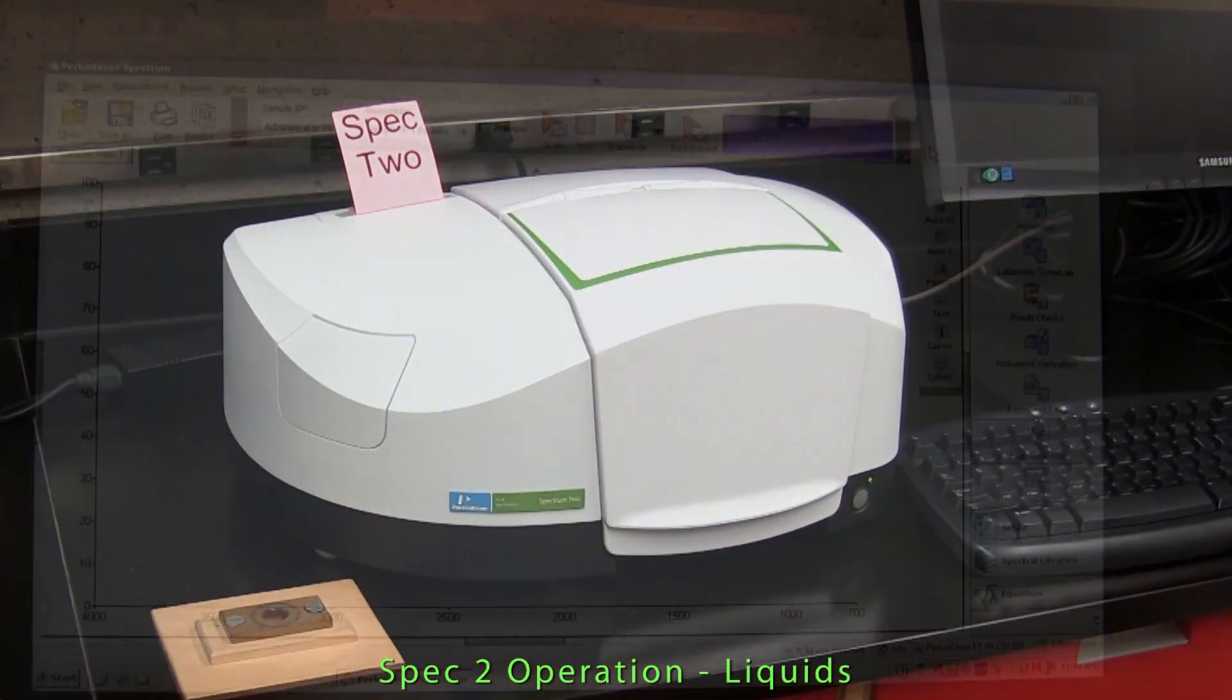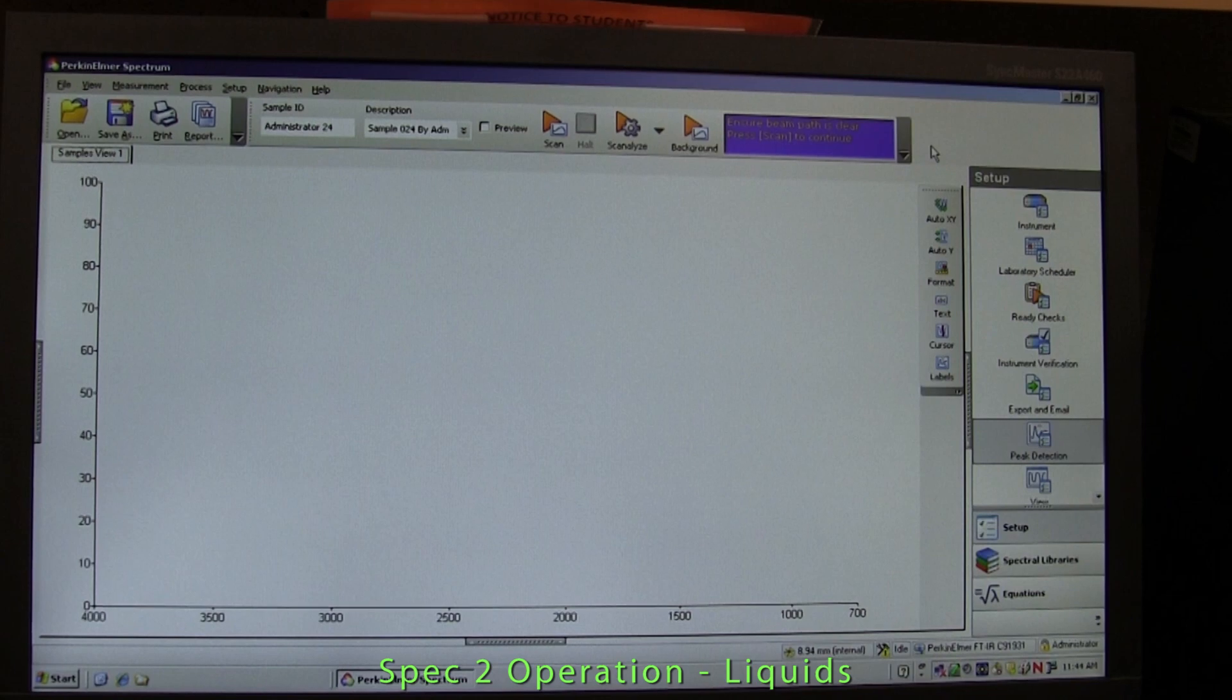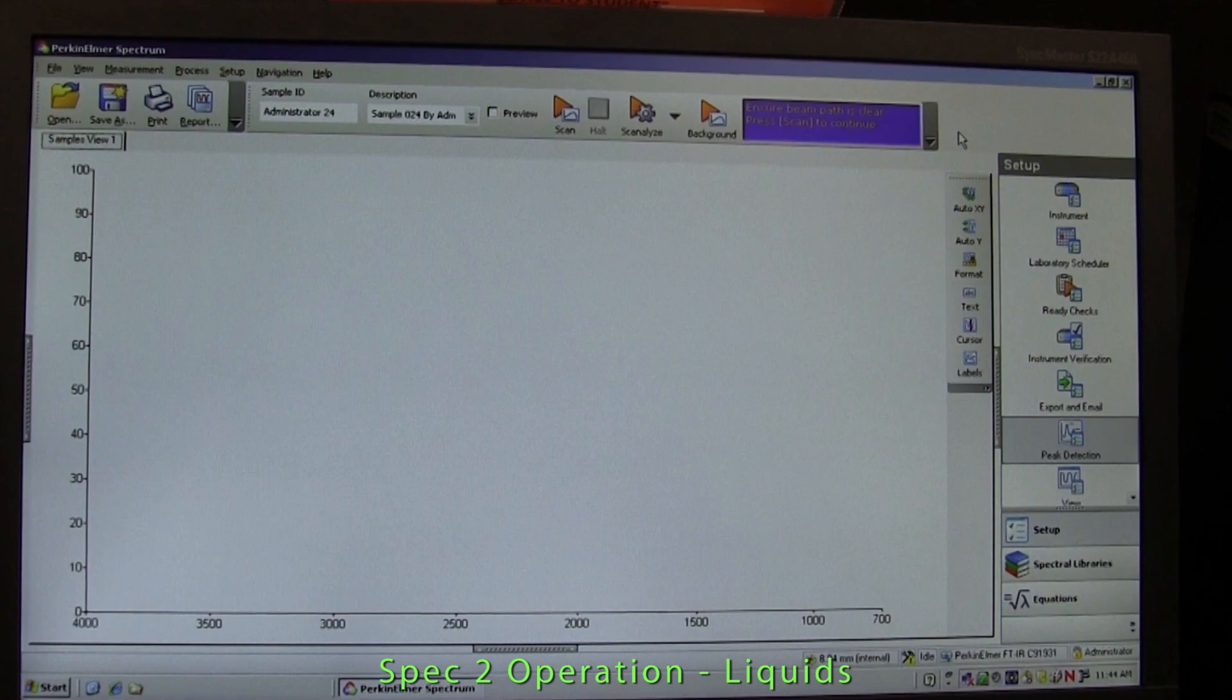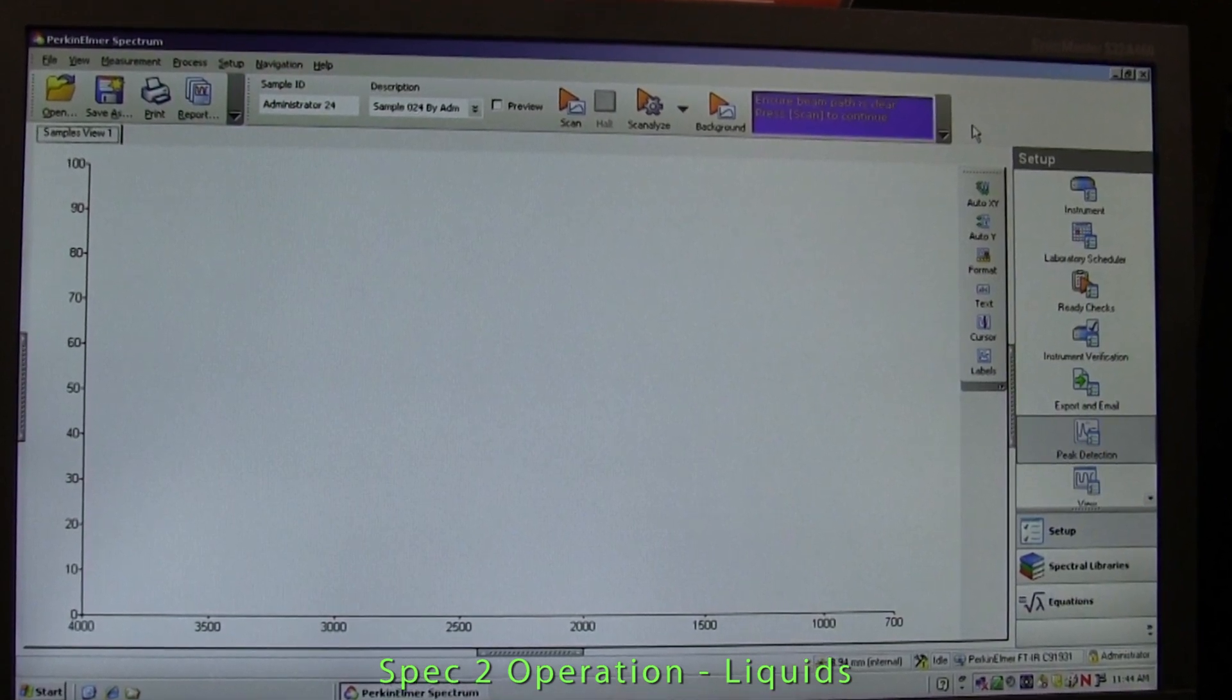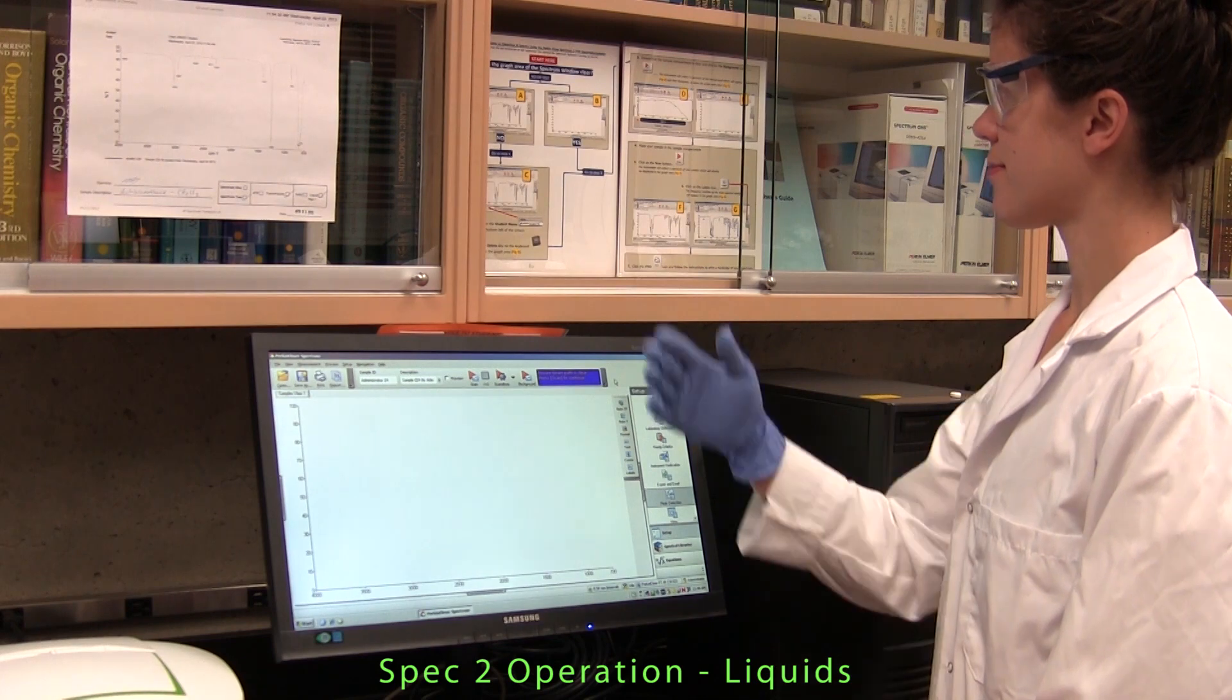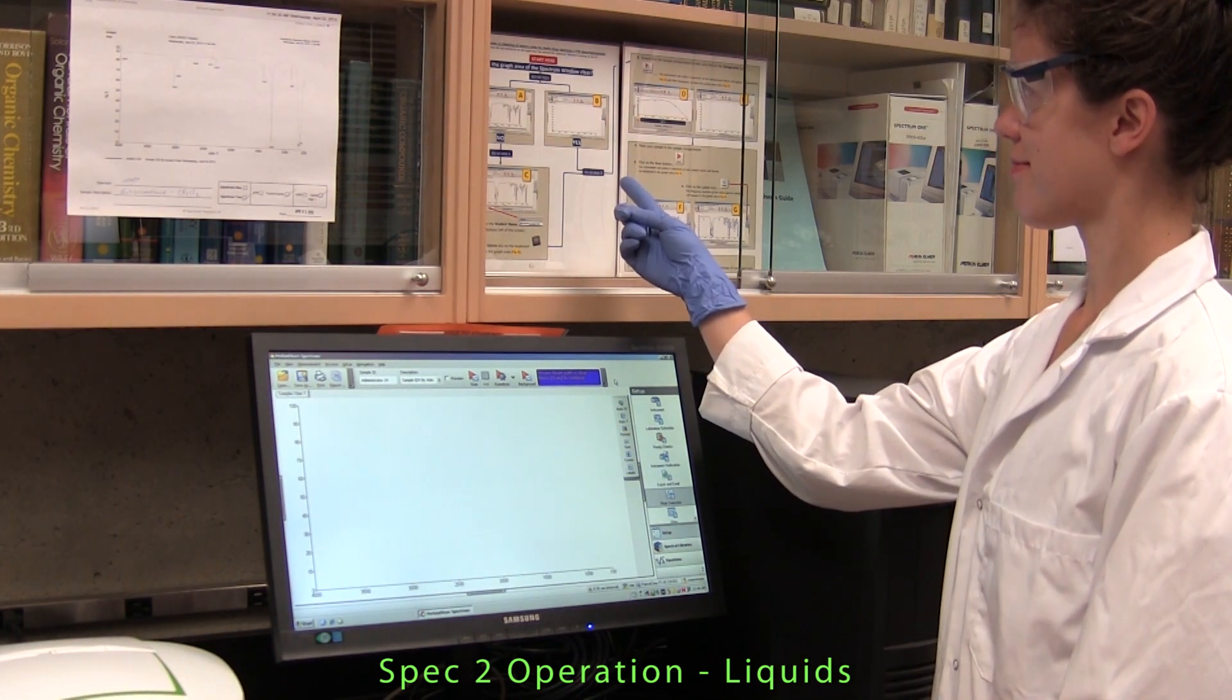As was the case with SPEC 1, the instrument should be on and the computer software up and running. If this is not the case, see your lab supervisor or the lab technician.